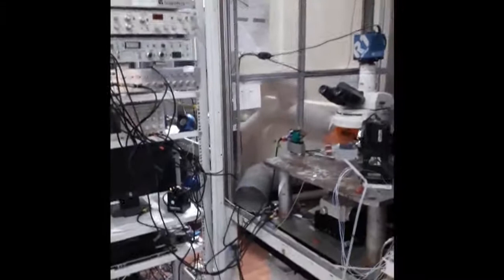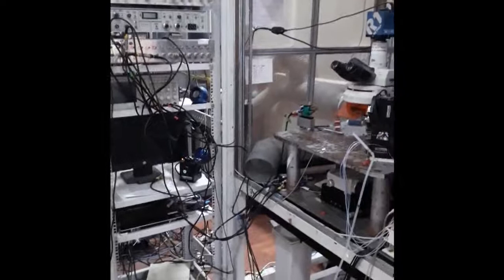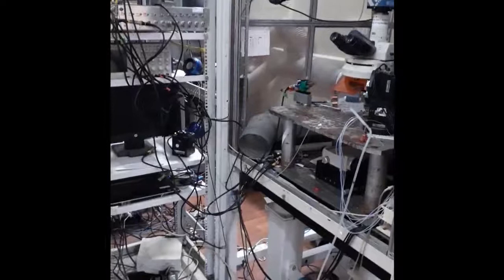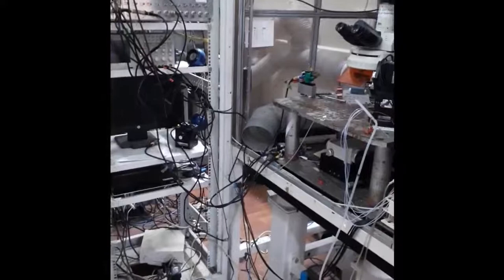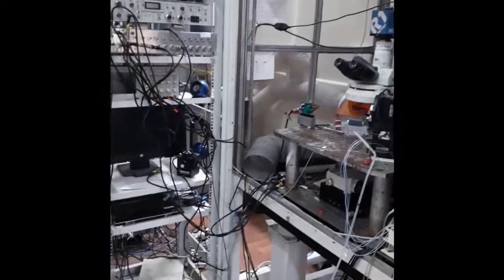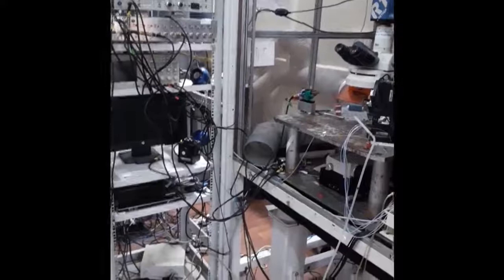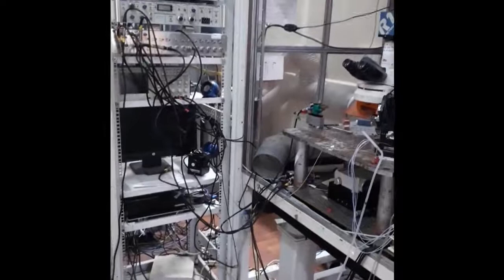Here is what we call a rig, in which we actually carry out all these electrophysiology experiments, and sometimes electrophysiology coupled with behavior. It involves, as you have learned, how the signals are recorded, transduced, amplified and recorded, which you have learned in your first semester. Though it may look a little complicated at first view, it is essentially all the things which you have learned in your first semester. As part of the lab, you will learn how these can be used and how they relate to the theories you have learned in the first and second semesters.